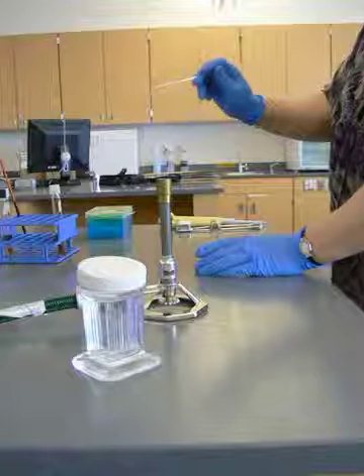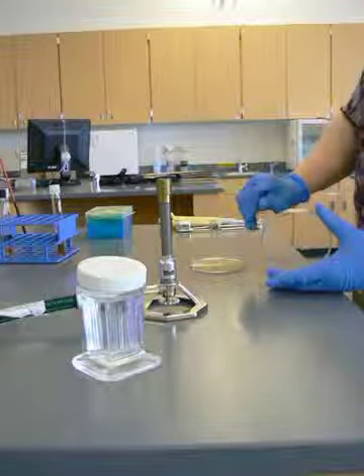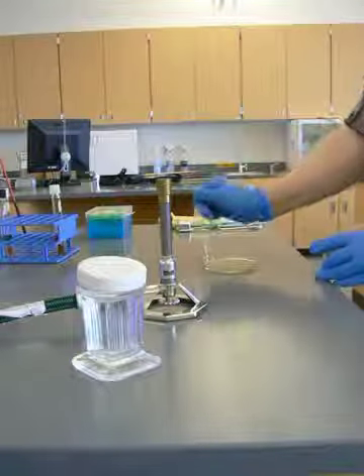Now, I'm going to wait for this to cool a little bit. Now, I'm going to take this and I'm going to spread my inoculum out as evenly as possible.